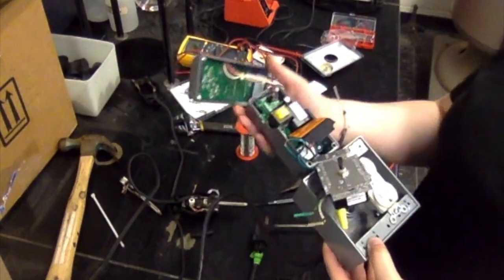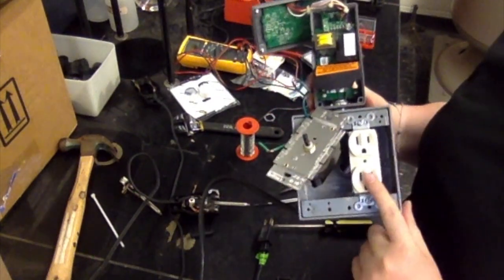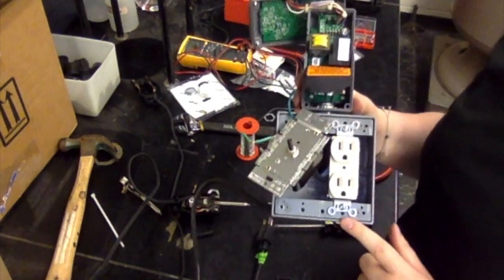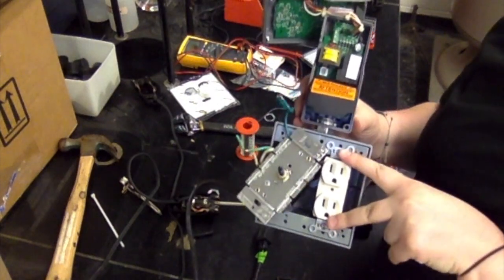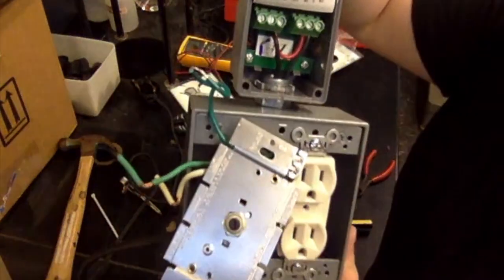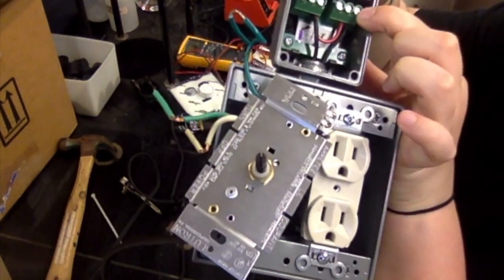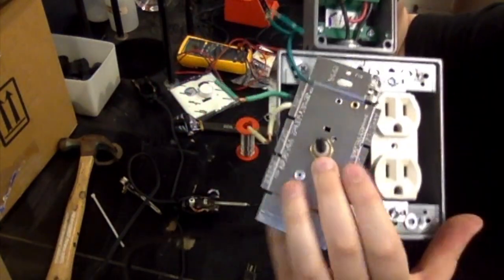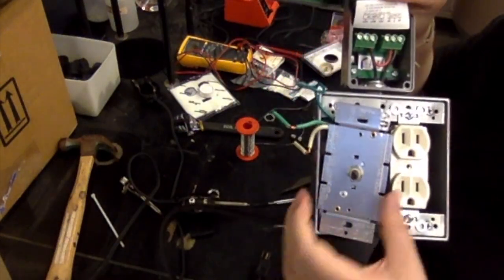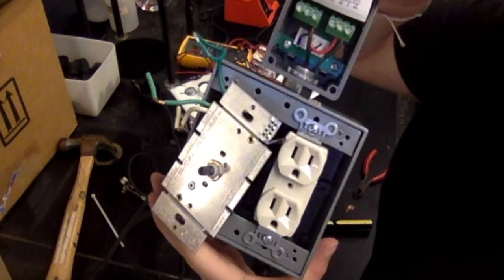Okay, so all those connections have been made, and we're going to go ahead and mount the 2-gang outlet into the box. To do that, again, you're going to want it to be on the right side, and you'll fasten it with 2 screws here. You'll also notice that I have gone ahead and put the extension that we made from the dimmer switch into port 6. Again, that's feeding back behind. And again, you'll see I don't have any wires that are coming up in front of the 2-gang outlet, which is important. I'm not going to fasten this because we have a couple more connections to make, but I wanted to clarify this orientation before we move forward.